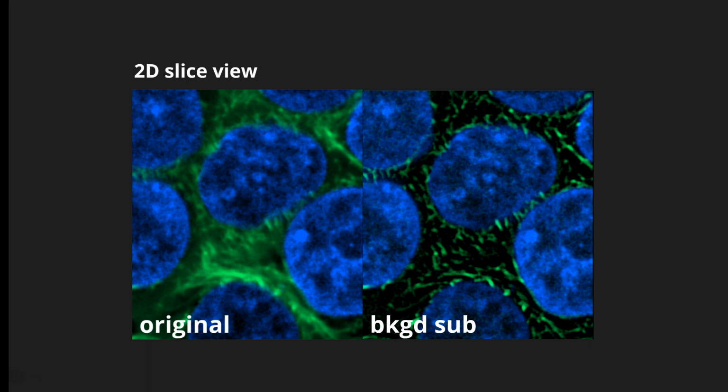Okay? So for the purpose of being able to segment out these tubules, it's going to be an awful lot easier to do it with this one than this one. Now, I will warn you, both the smoothing filter and the background subtraction are destructive changes. It's changing the data in your image. So when you're using them, you need to be sure you know why you're using them and you're not just using them because someone said I should use them. They are destructive.